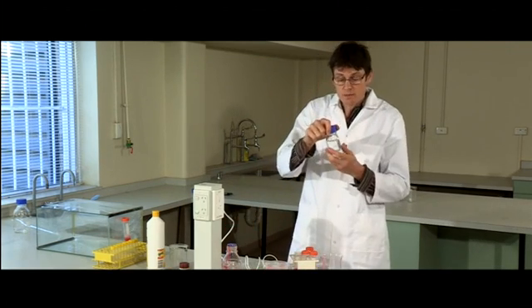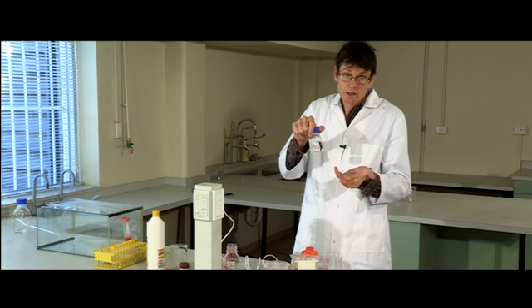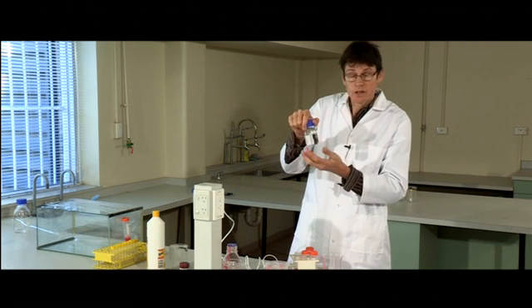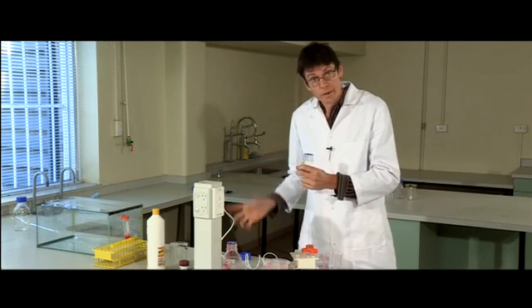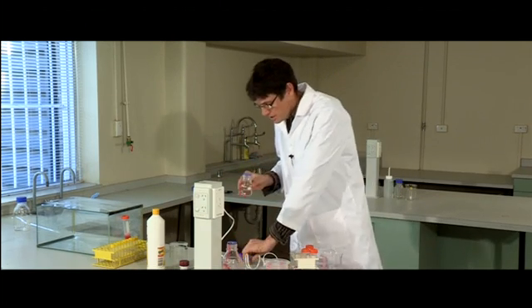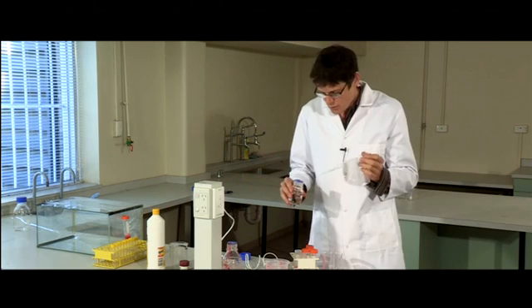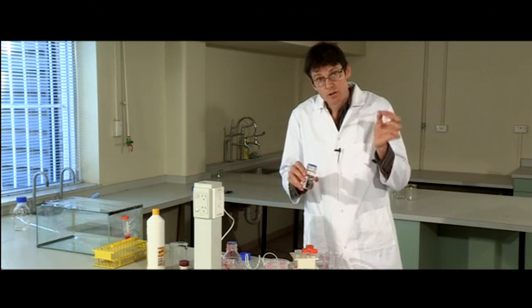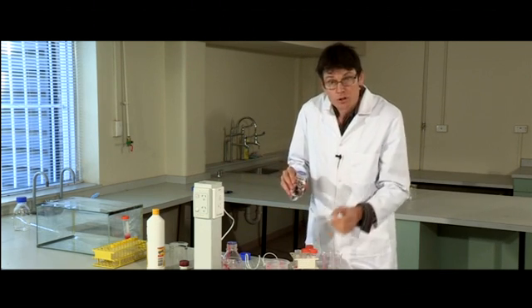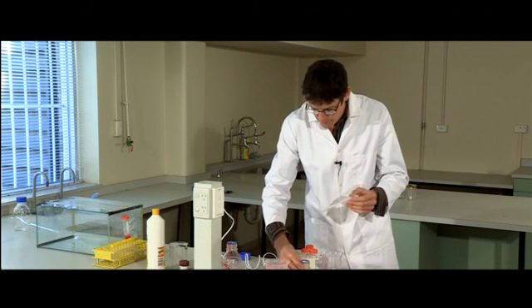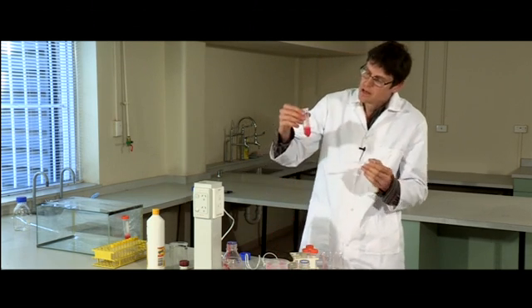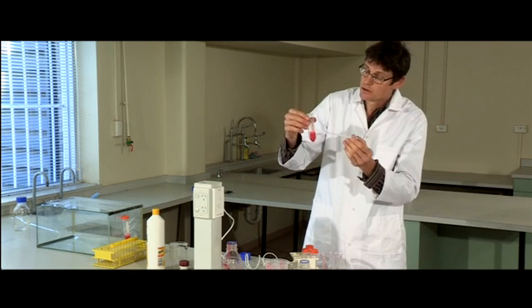Now the next step is to add alcohol. You can use methylated spirits. I've got 95% ethyl alcohol here—metho works just as well, or rubbing alcohol you can get from a chemist. The trick here is to make sure the alcohol forms a layer on top of the strawberry juice. Add about the same amount of alcohol as you've got strawberry juice in there.